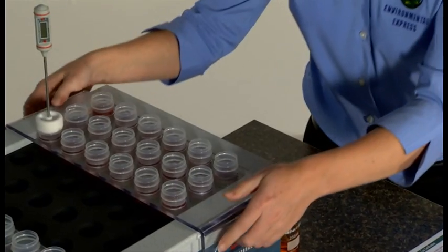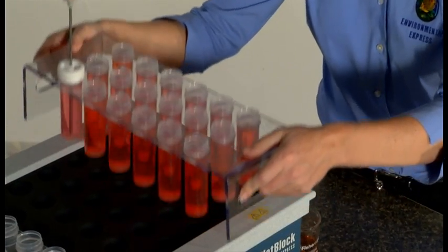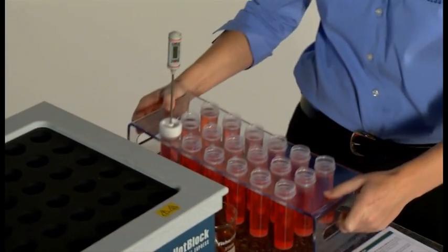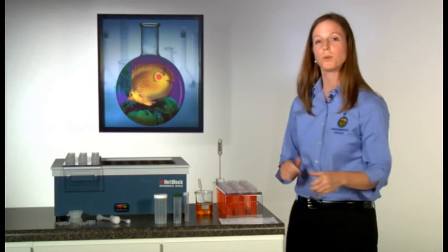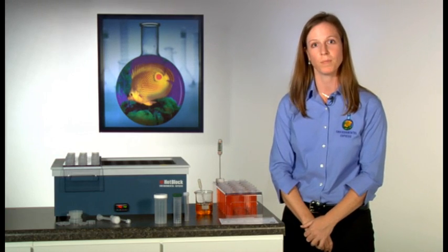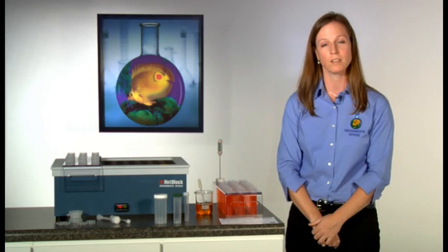Now the samples are removed from the block, allowed to cool, and brought back up to volume. They are now ready for filtration or analysis.